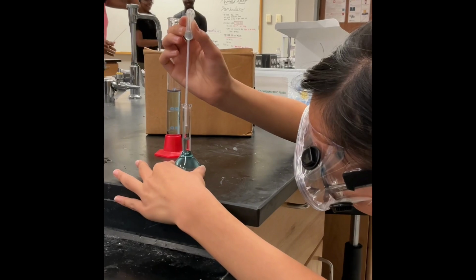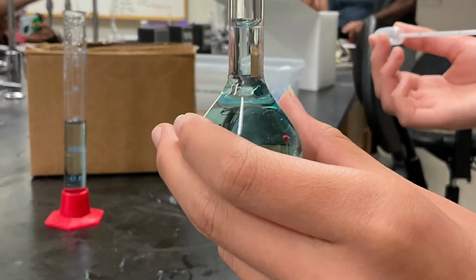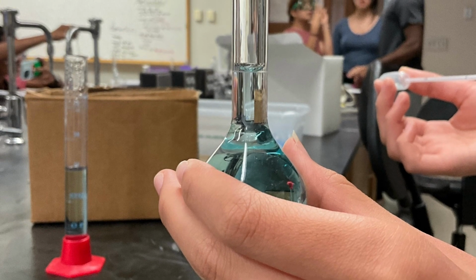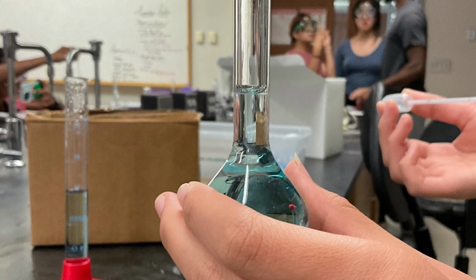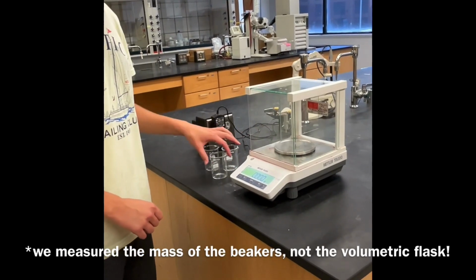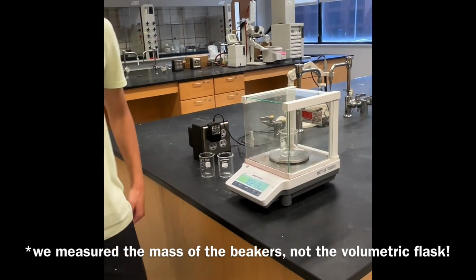For example, water molecules are attracted to the molecules on the wall of a glass beaker, but the water molecules are also attracted to each other and tend to stick together. When the water touches the glass, it pulls the additional water molecules up along the side of the glass, creating a small dip in the center, which is the meniscus.